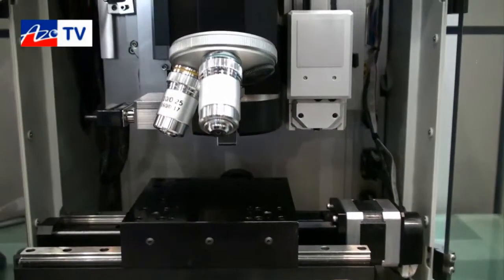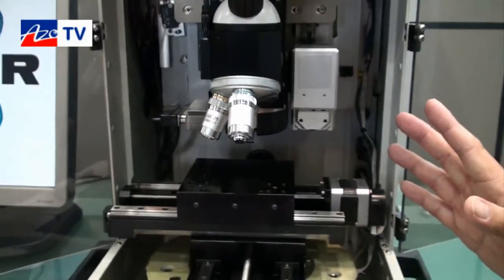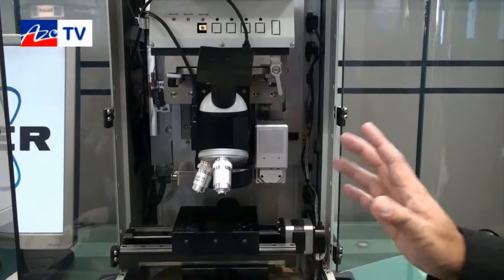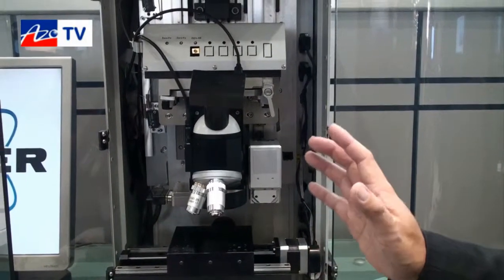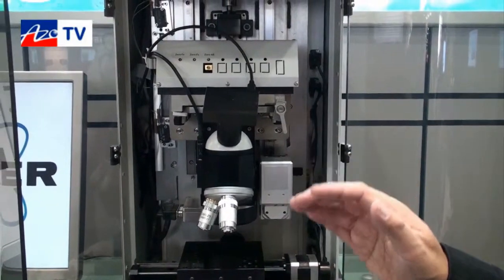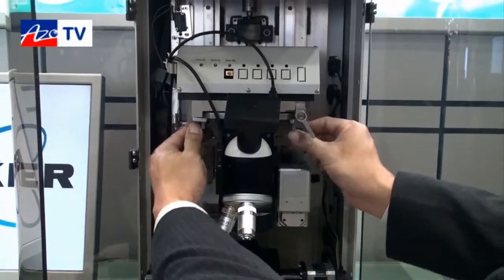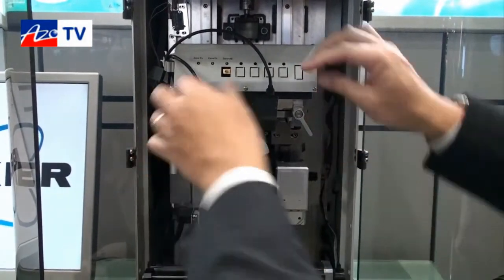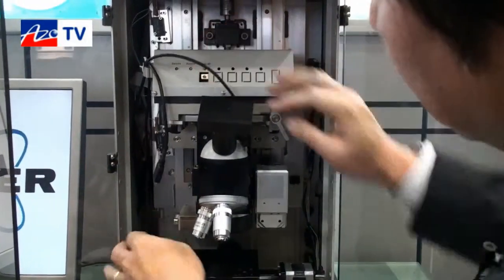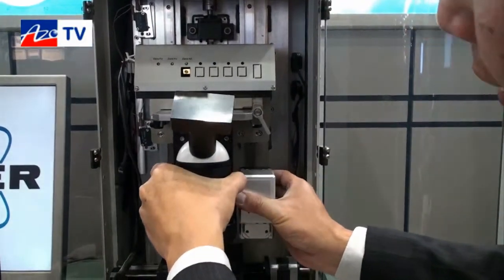This is the nano configuration. Our system has the particularity that it's very flexible and modular, so it's very easy if we want to do micro indentation, which is a higher load level up to two newtons. We just need to remove these knobs here, disconnect, and then we can remove the whole unit.